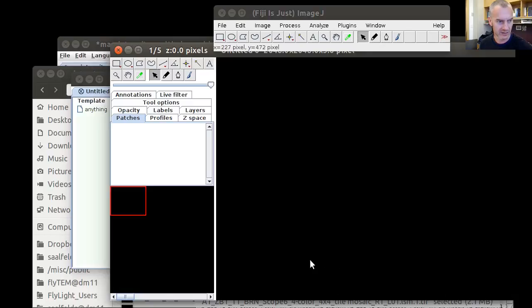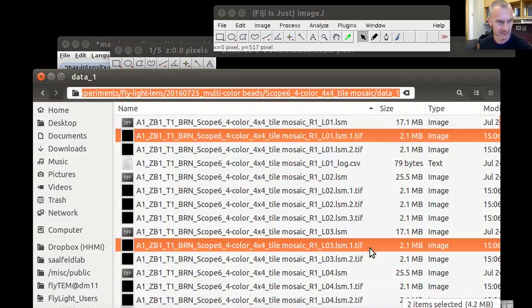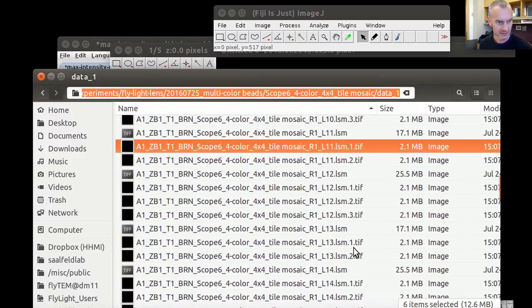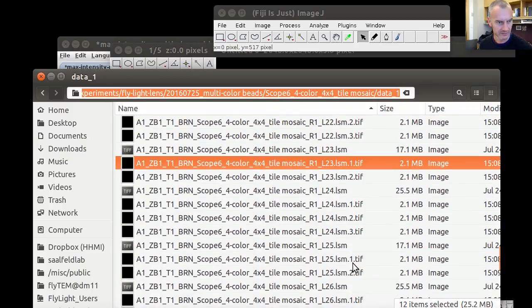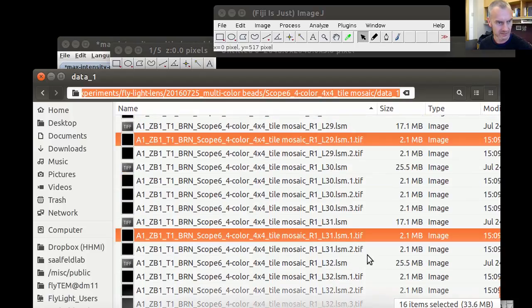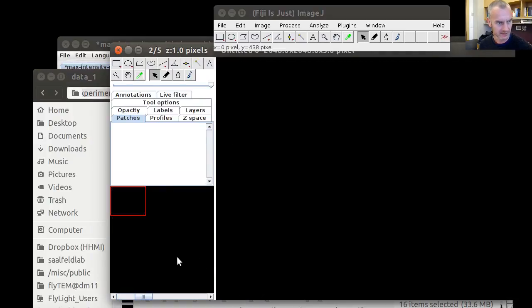Now we're going to import the files that we generated before into these layers, and I haven't found a reasonable way of automatically selecting them. One should probably write a script to do this. It's not happening so often. I'm doing this manually here. I'm going to have to do it only 5 times because we have only 5 channels. This was the first.